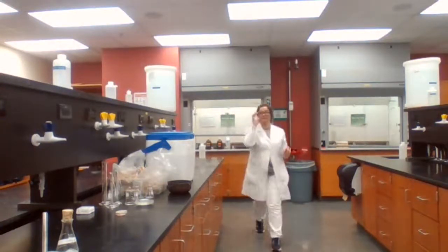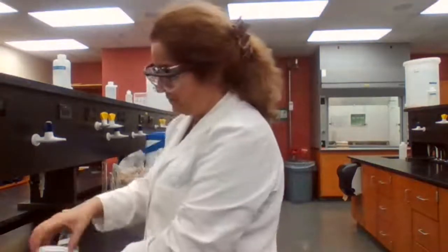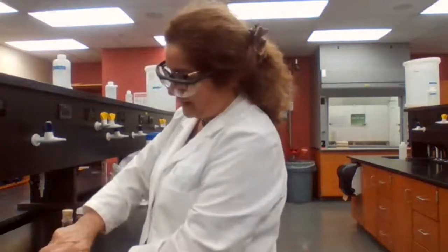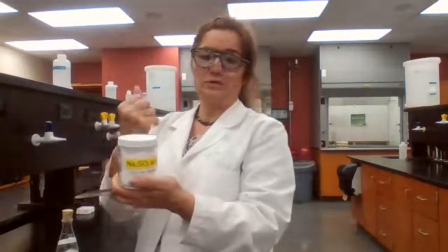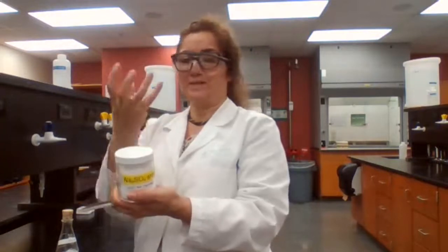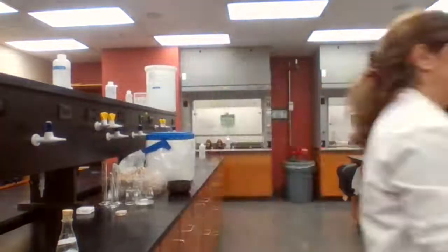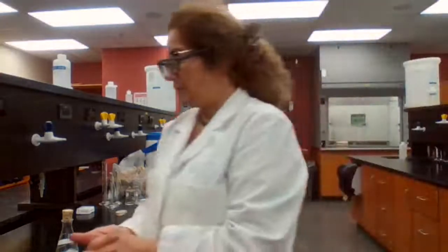And we check it later. By the time we are done with my part of the experiment, that should be done. Sodium sulfate, because it's an anhydrous agent, should stay closed all the time. Otherwise, it would absorb the moisture from the room, and when it does, it becomes like a one-piece rock. It won't work, it won't be efficient, and it's not going to be useful anymore. Now, we have our organic layer in the fume hood waiting for it to dry.